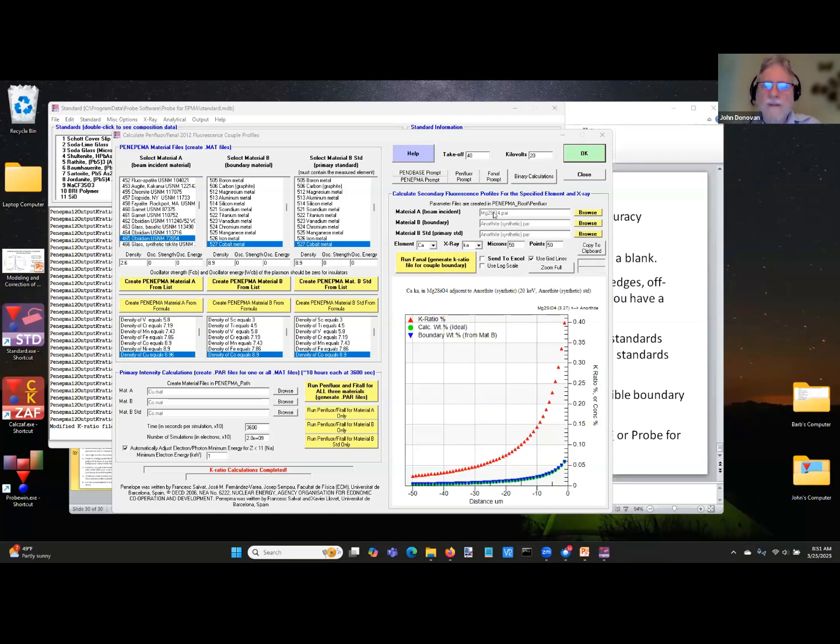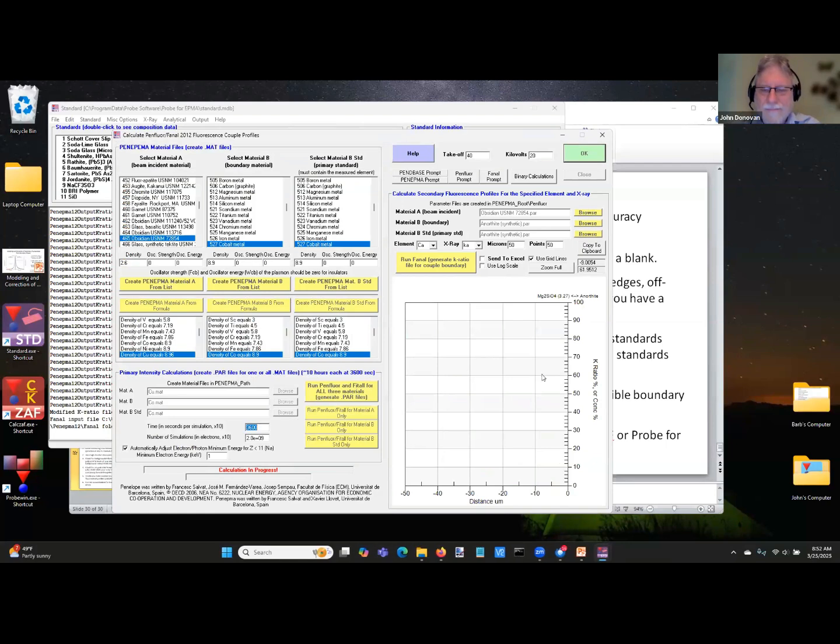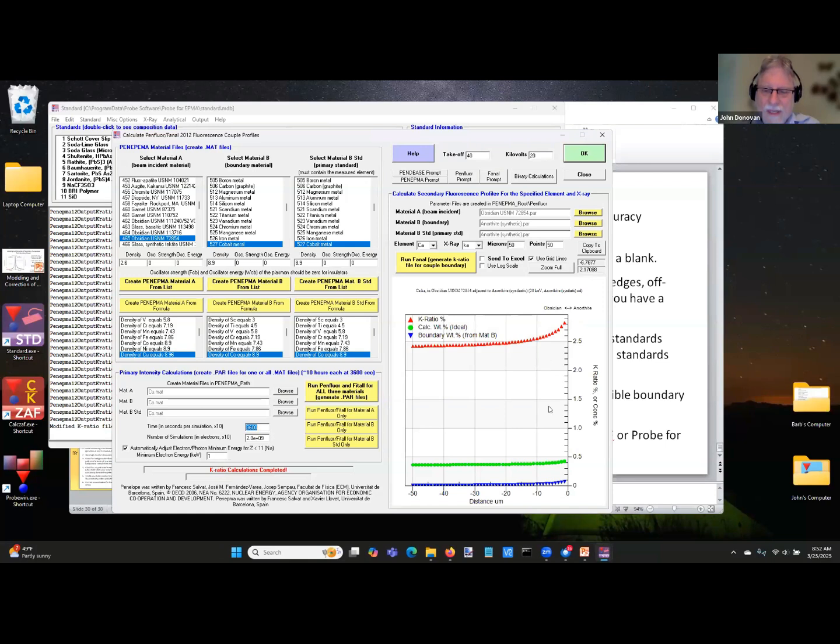The only reason the obsidian example didn't show up so well is because there was a whole bunch of calcium in the obsidian, so it was swamped by the actual calcium measurement in the obsidian. Here, I can show you that effect. If I go back to this obsidian and then I just run it again, you can see the effect here. This much is the amount that's actually in the material, and this is the amount that is from the boundary only. So it is visible. You are getting about 1,000 ppm, but it's just not huge in the overall scheme of things. But it can work with glasses, minerals, alloys, pure elements.